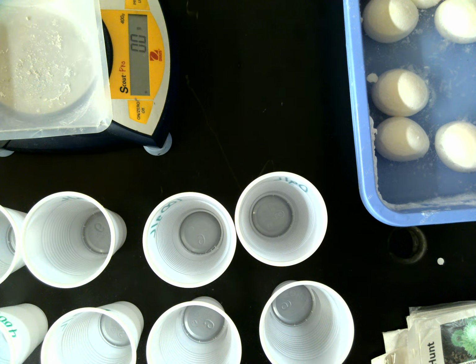All right, everybody. Today we're gonna be doing this egg lab, osmosis lab. We're studying the effect of different solutions on osmosis in these eggs. Essentially, we're using these eggs as a model for a cell, which is surrounded by water, either blood or interstitial fluid. And water is going to either go into or out of the cell depending on the kind of solution that it is in. So you guys are going to take some measurements as I take them and just kind of follow along here.